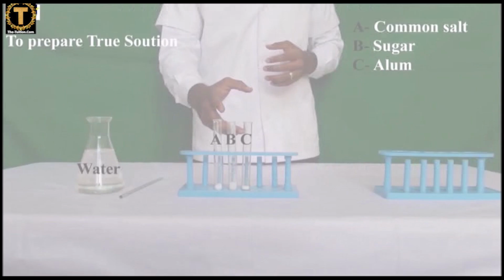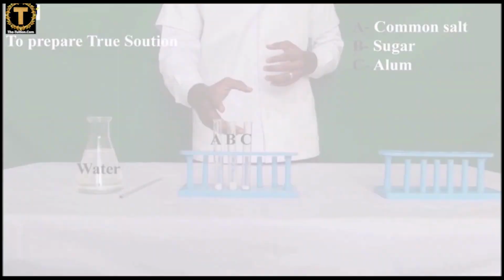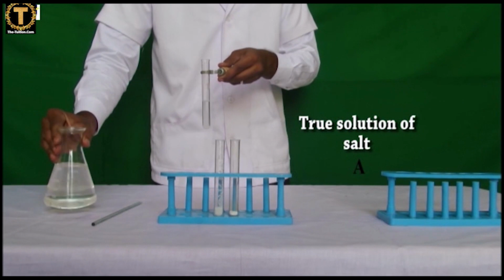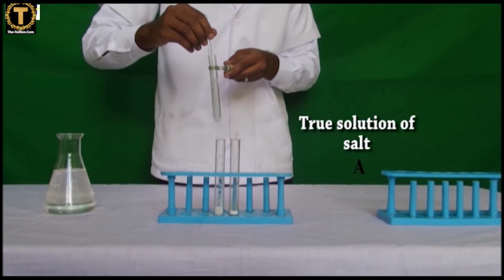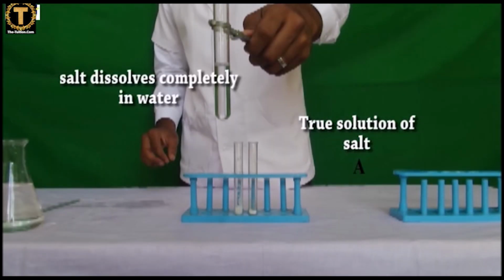Procedure. A. To prepare a true solution of common salt, sugar and alum. True solution of common salt. Take a clean test tube, pour 2 to 5 ml of distilled water in it and add dry common salt in it. Stir the content with a glass rod. Common salt dissolves completely to form a true solution.